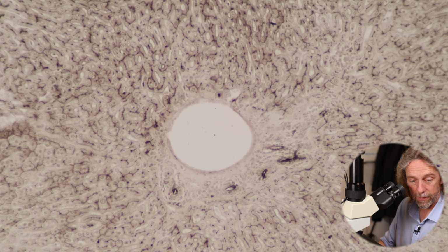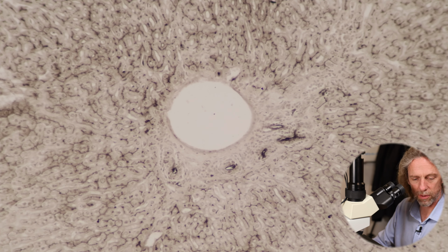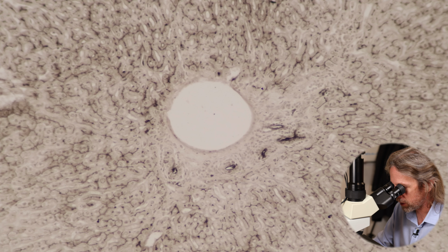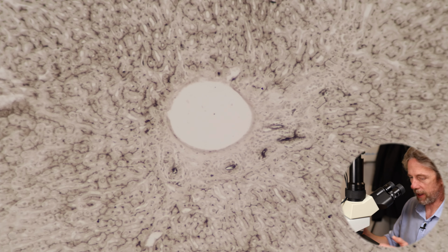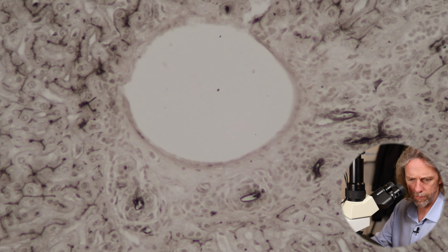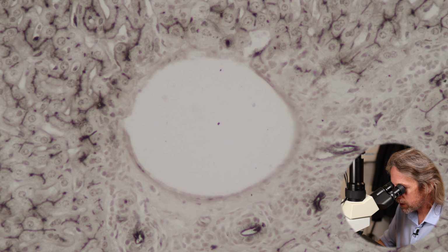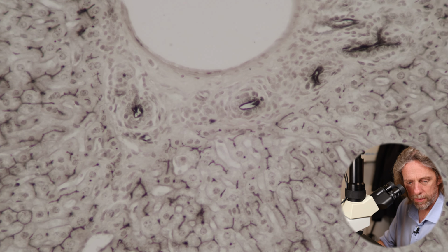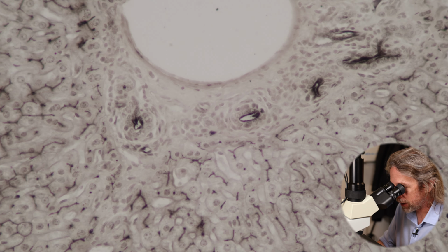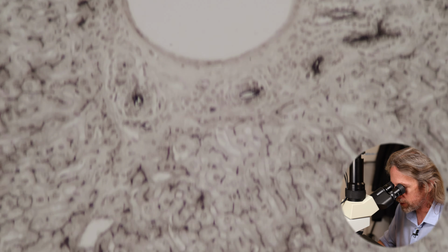So now you can see that central circle is not a bile duct, but you can see those other smaller circles. Those must be bile ducts because there's quite a lot of alkaline phosphatase labelling there. Let's go up again. What's this? 20 times objective. See what I mean? That's a blood vessel in the middle. But these little tubes down here, you can just about make out the simple cuboidal epithelium, and there's a black stain on the inside, so they are carrying bile away from the liver.